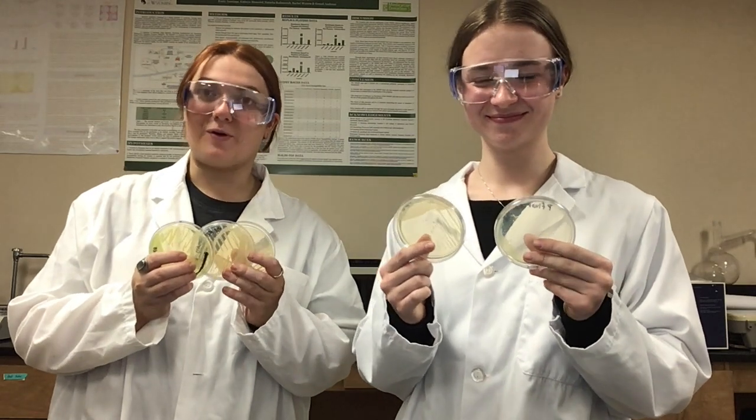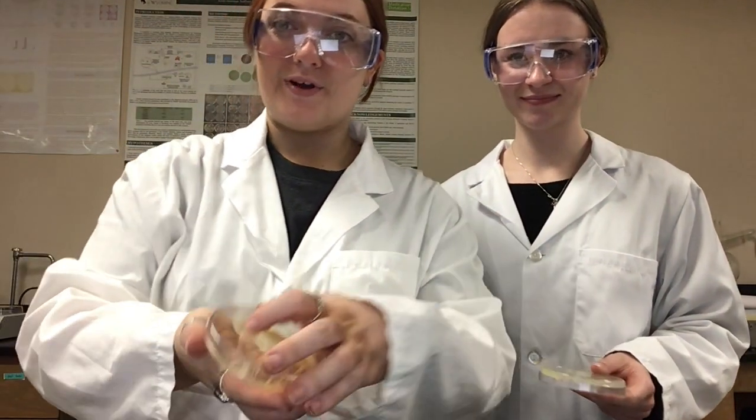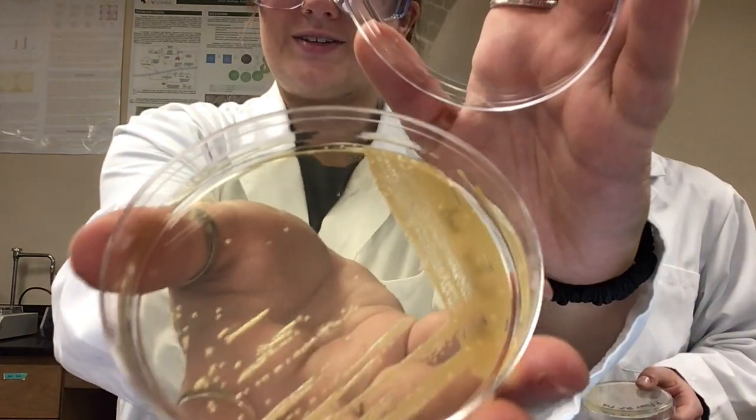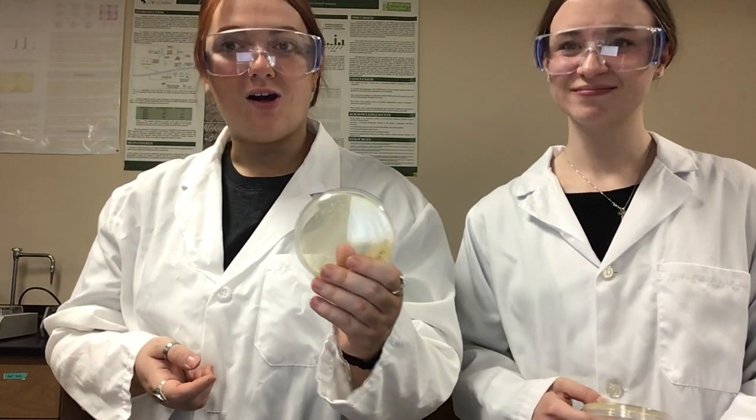There's a countless number of bacteria that you can use for your microbial art. Today we'll be going over some popular options that are used when making microbial art. Our first example is called Micrococcus luteus. Micrococcus luteus is a gram-positive cocci that can be found in a multitude of places, including soil, dust, and even your human skin flora. M. luteus is likely to give us bright yellow colonies to work with in our art.